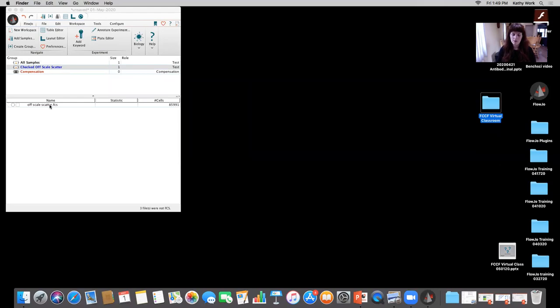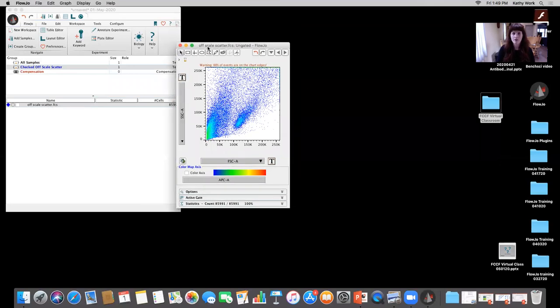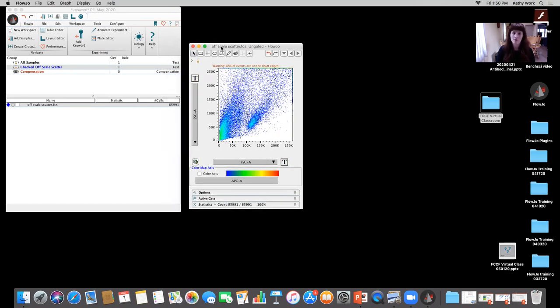And this is something that had happened on an instrument that I was made aware of after the fact. I want to show you the difference of how gating can actually have an impact on end populations. It's one thing if you're doing analysis, but if you're sorting, you have to be very mindful that as you're doing your controls, as you're setting your gates and all of that, it's going to impact the number of cells that you get back. Okay, so we always have to make sure that you're confident in what you've put in place to physically isolate and get cells back if you want reliable results.